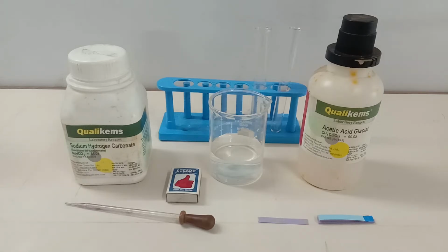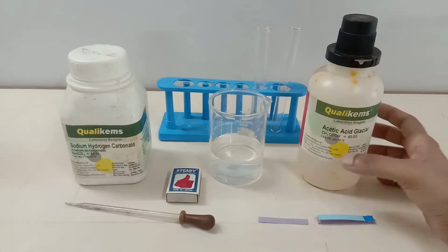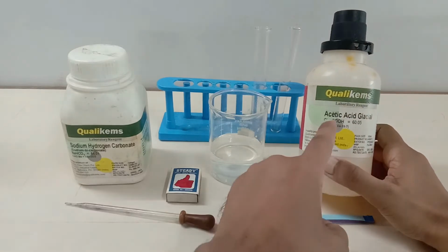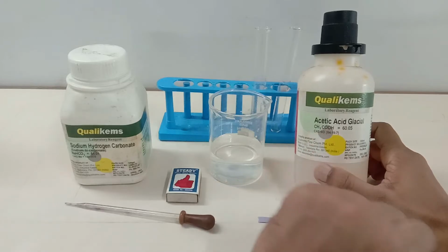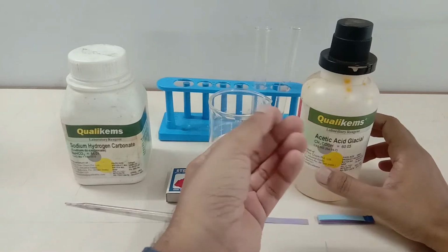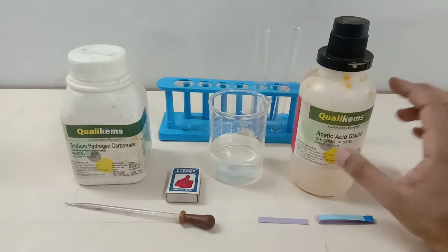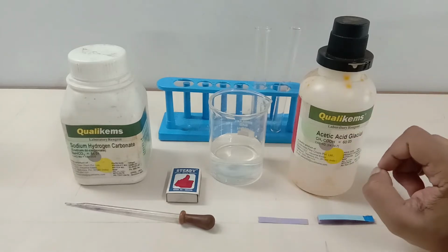So today I'm going to demonstrate some of the properties of acetic acid, which is also called ethanoic acid, CH3COOH. You can see that the functional group is the carboxylic group, that is COOH, and it's a very weak acid, guys, right? So if it falls on your hand, not to worry completely. And you might be amazed to know that a 10% acetic acid solution is also called vinegar.